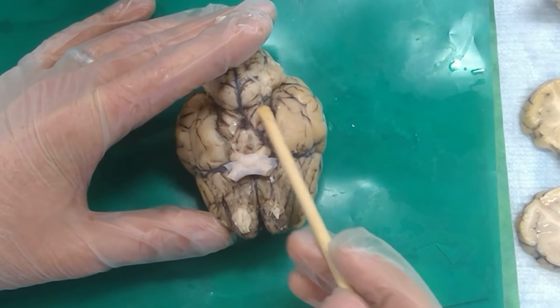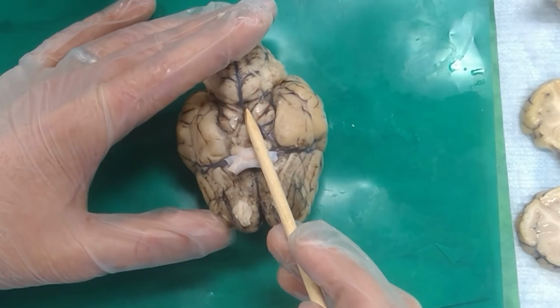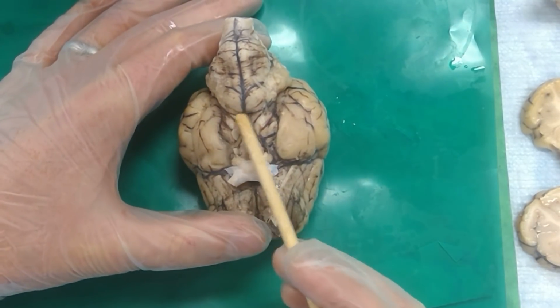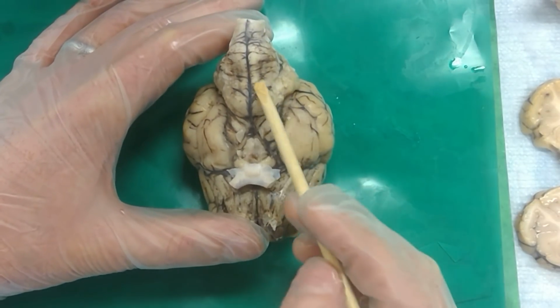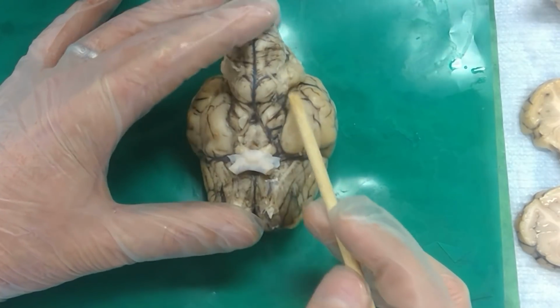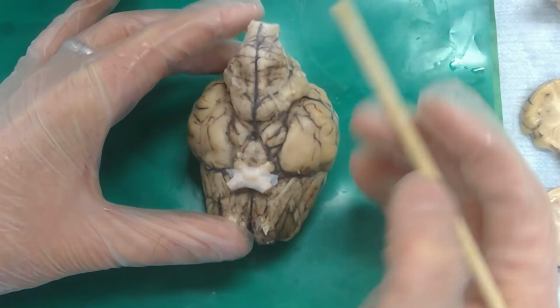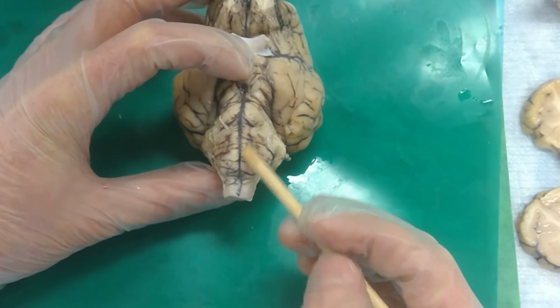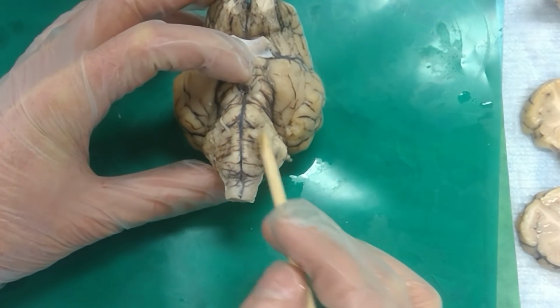Mesencephalon. So this is the mesencephalon here. And what is the space outside the brain between the peduncles? Interpeduncular cistern. Right. And then this guy right here, pons. And there are fibers that are going right across here. And then we've got these nerves right here. Abducens. And then we've got these fibers running along right here. Right. And then this last portion right here.